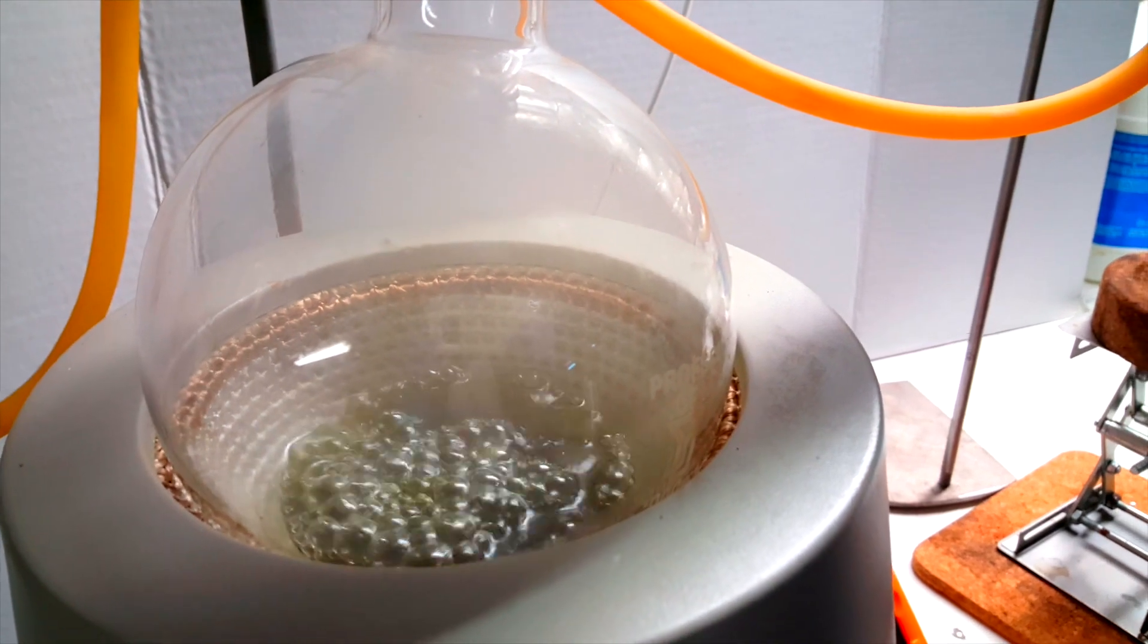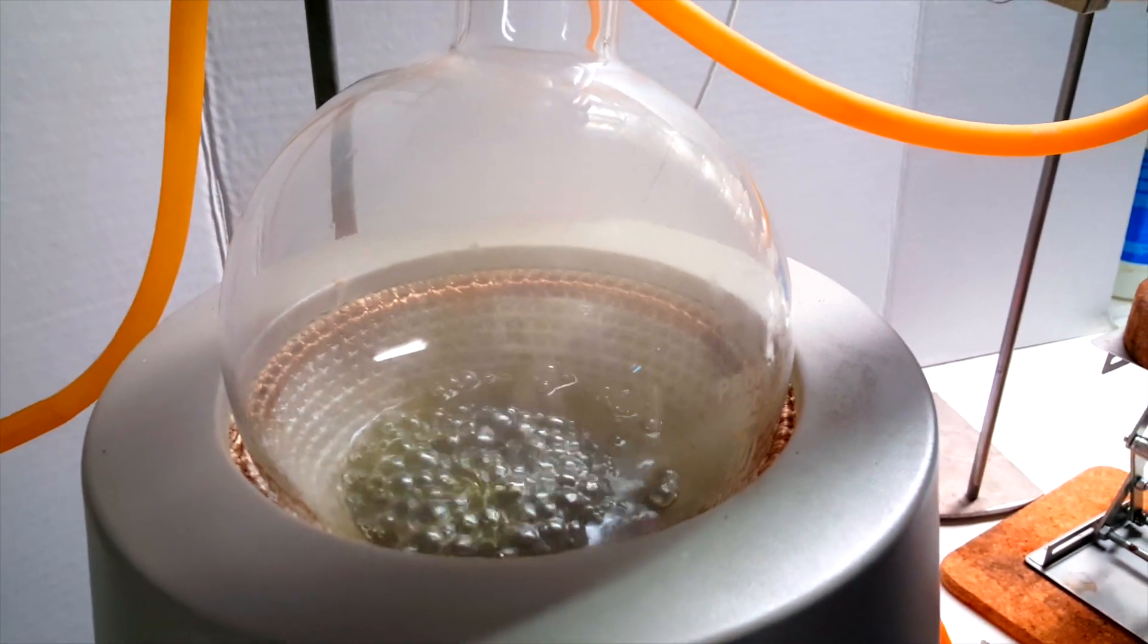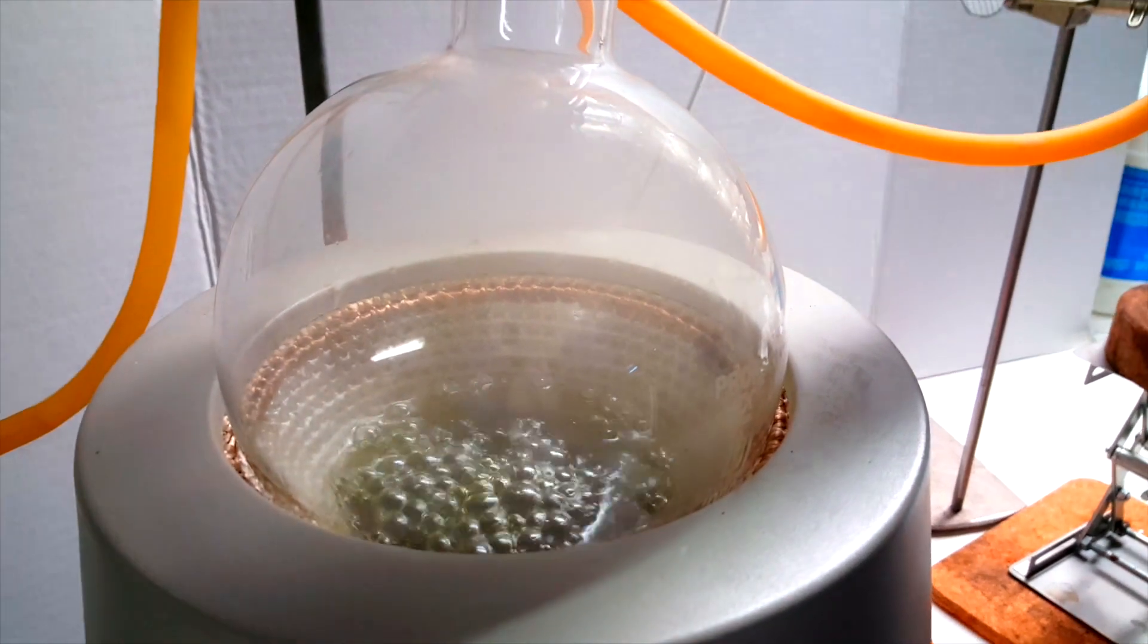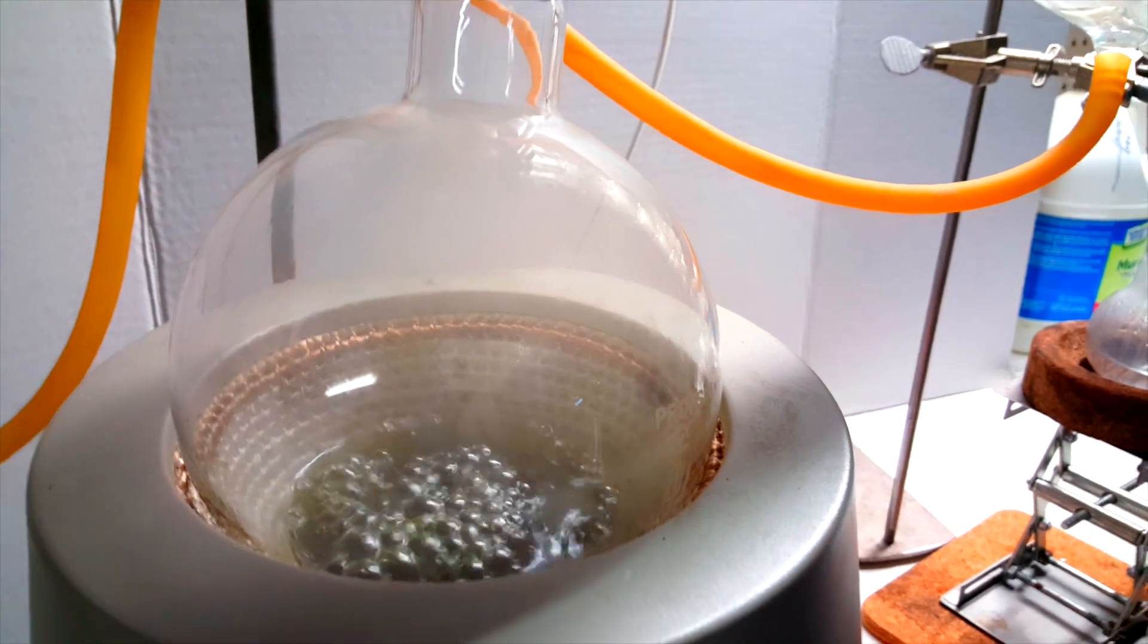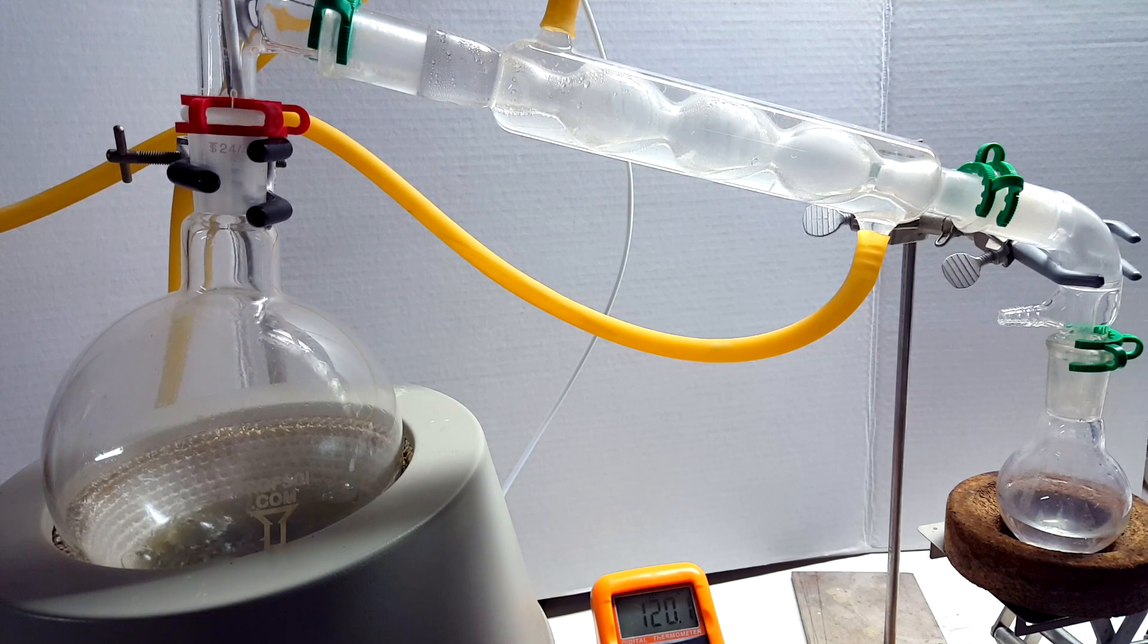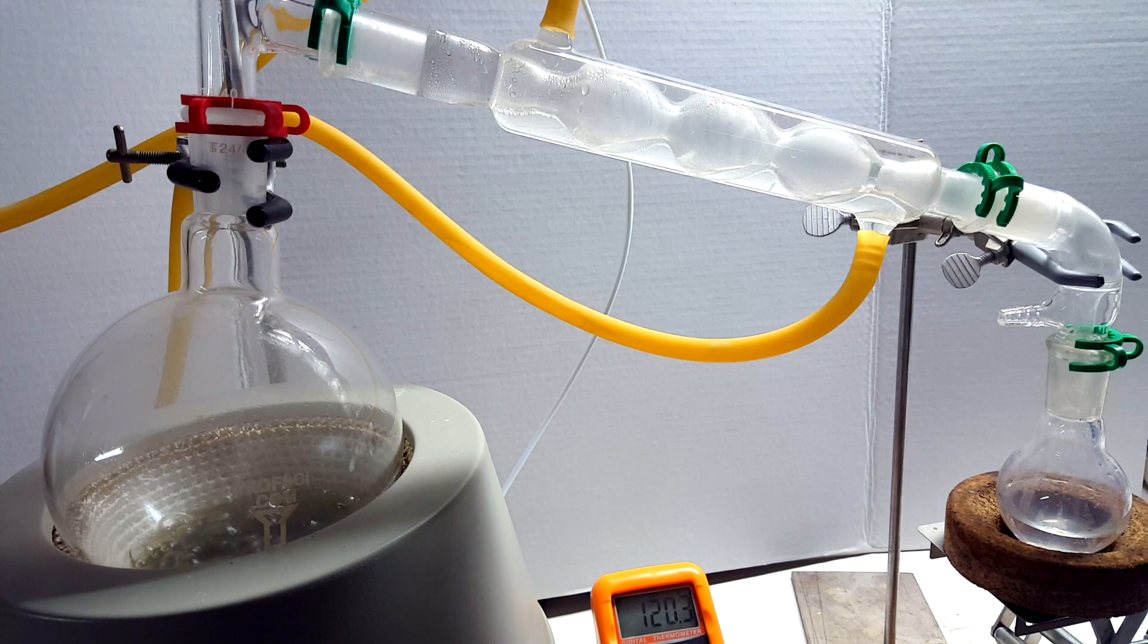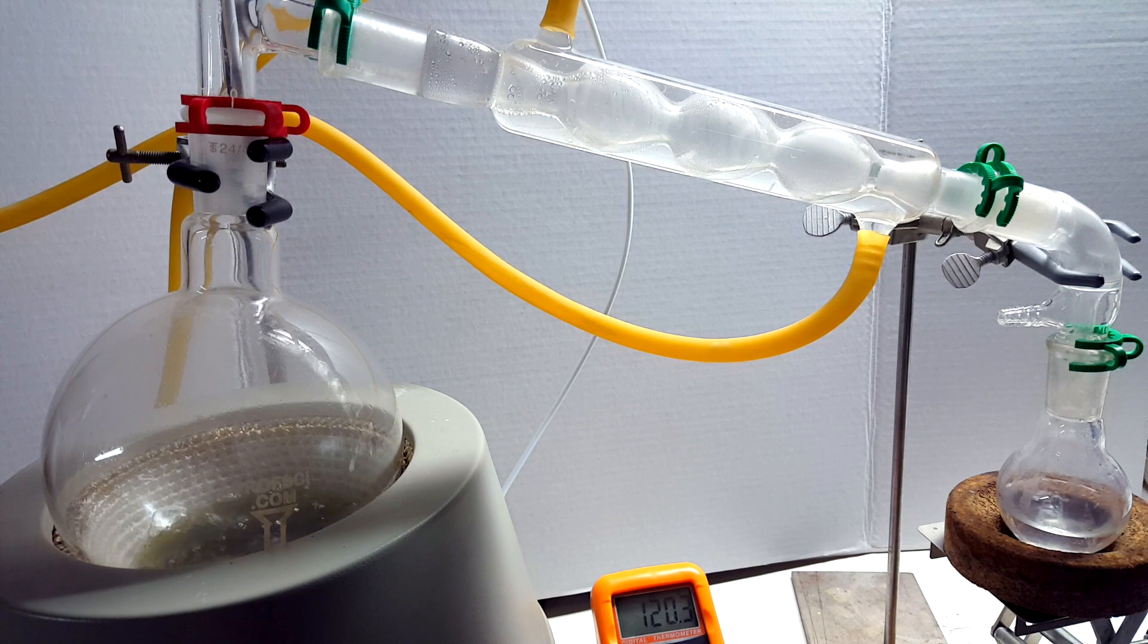At 117°C, you can see a thick smoke beginning to form over the phosphoric acid. Although the acid does not theoretically degrade before 215°C, I suspect some degradation was occurring. At 120°C, the boiling and reflux slowed down quite drastically, so I turned the heat all the way up to push the temperature past the 158°C needed to distill the acid.